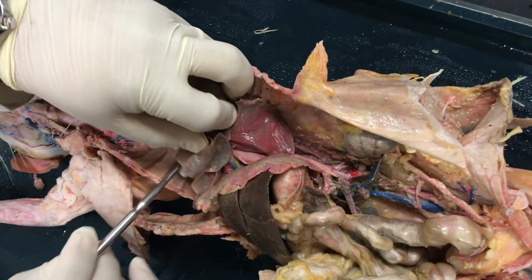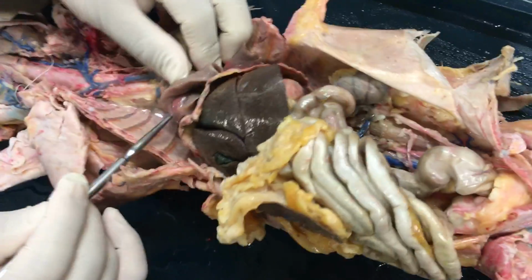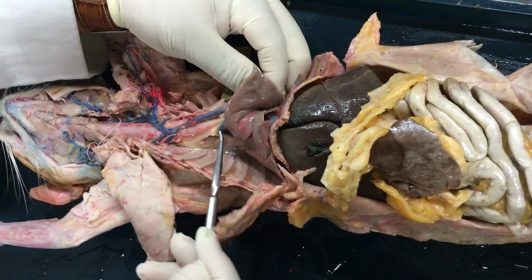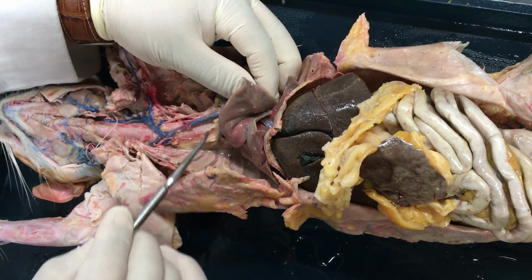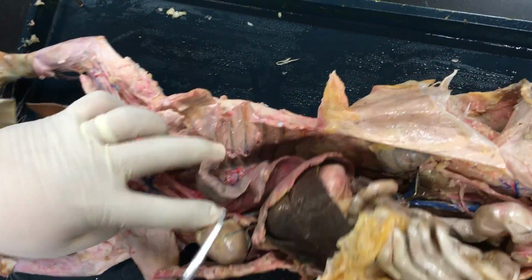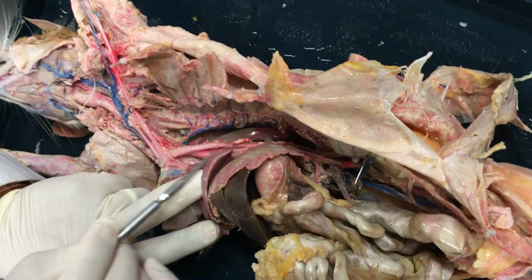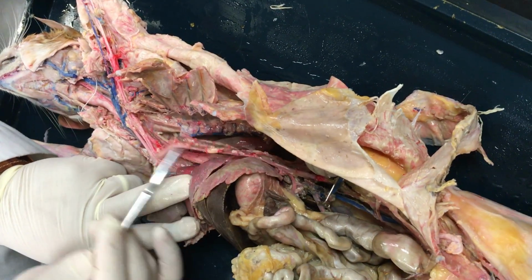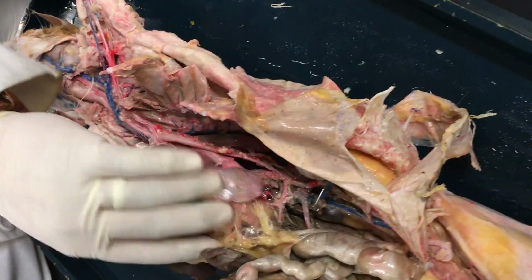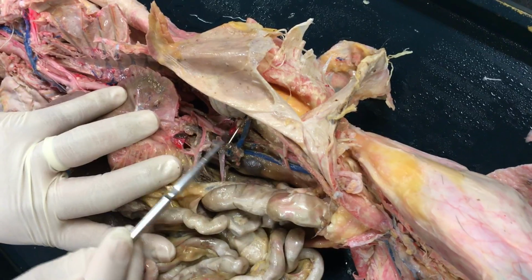One last vessel we want to consider here as far as draining into the superior vena cava, you have your azygous vein right there. So the azygous is going to drain these intercostals, and then the azygous drains into that superior vena cava as it's draining into the right atrium. And then, of course, on the left side here, you see where that aortic arch becomes the thoracic aorta. The aorta then continues to descend beyond the diaphragm into the abdominal cavity. So here now you see the abdominal aorta.